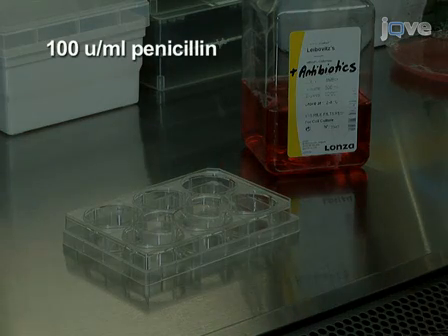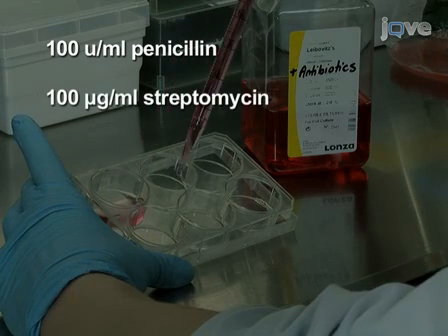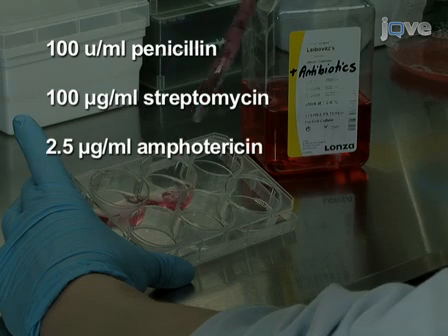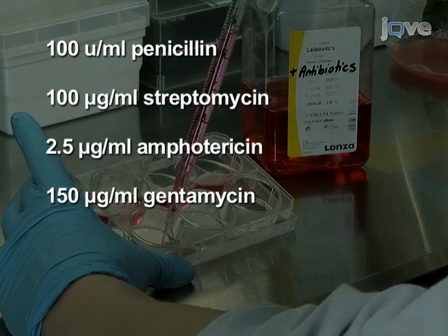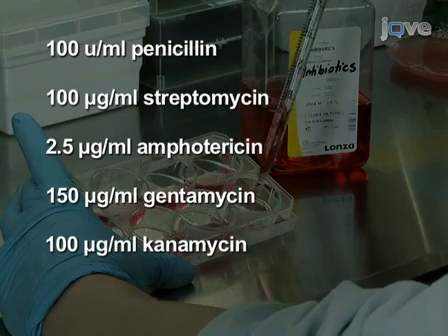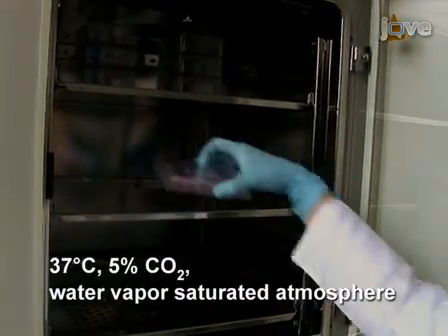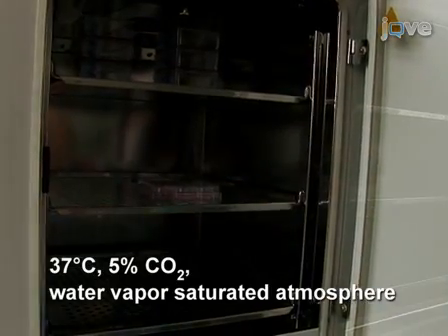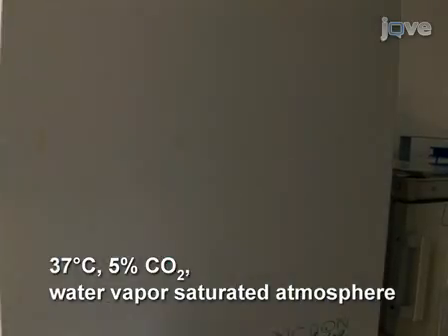supplemented with 100 units per milliliter penicillin, 100 micrograms per milliliter streptomycin, 2.5 micrograms per milliliter amphotericin, 150 micrograms per milliliter gentamicin, and 100 micrograms per milliliter kanamycin. Continue cultivating the cancer cells at 37 degrees Celsius in a 5% carbon dioxide water vapor saturated atmosphere.